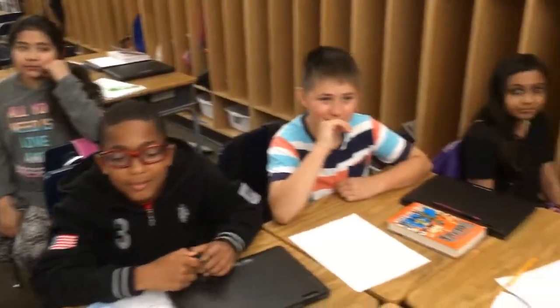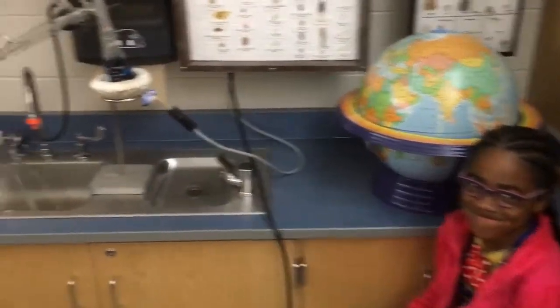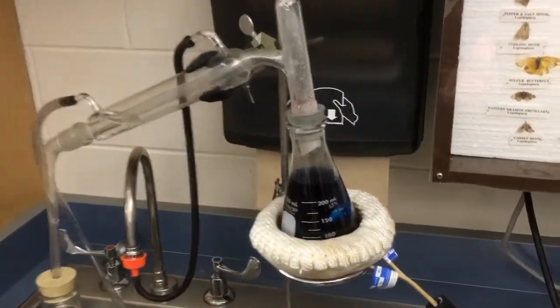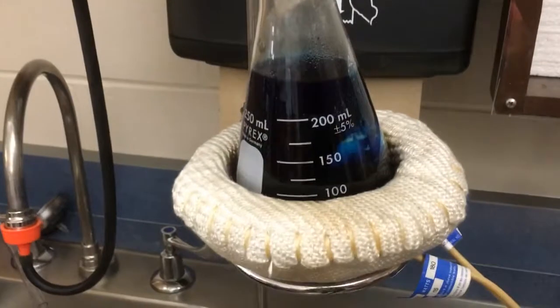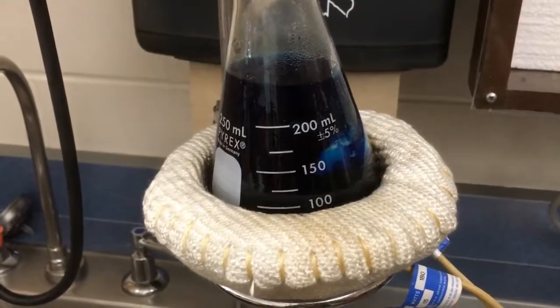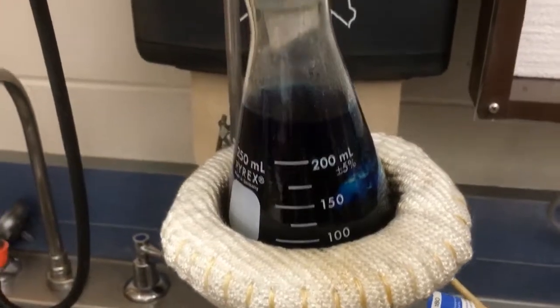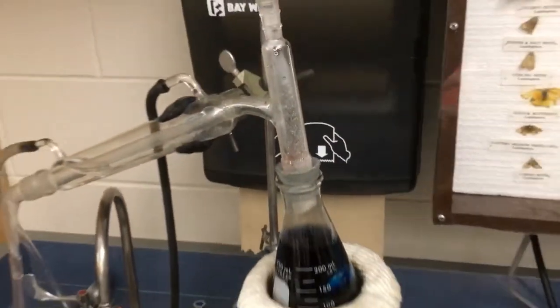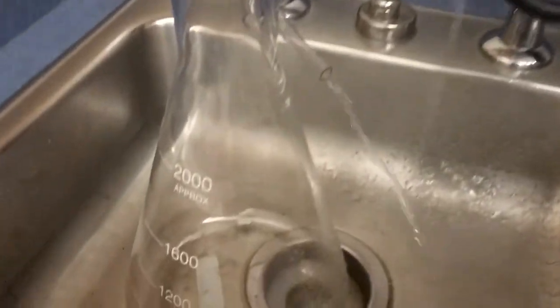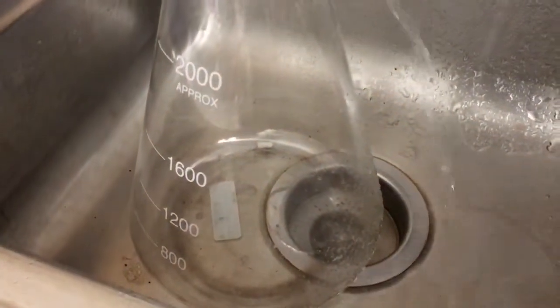We're learning about distillation and how distillation is similar to nature's water cycle. And I see a distillation apparatus here. We've got our first flask, and it's got a hot pad underneath it, and that water looks polluted. It's got food coloring and some other things in there, and we want to distill that dirty, polluted water into this second flask down here, where it'll be pure water.